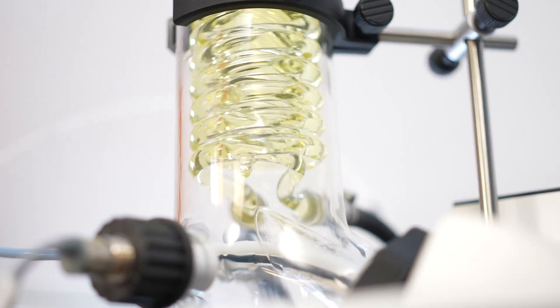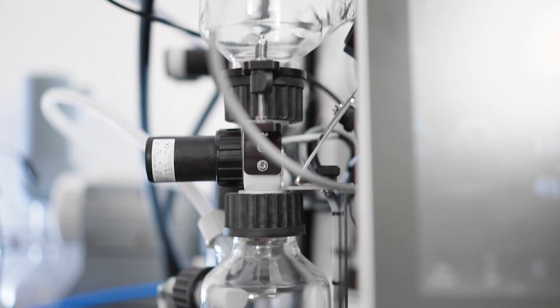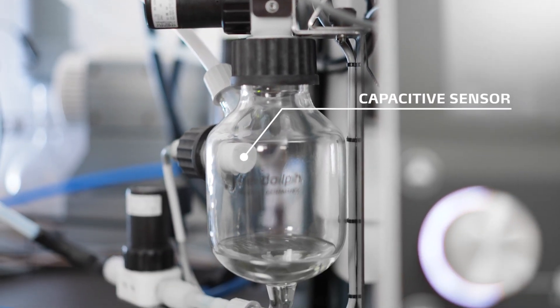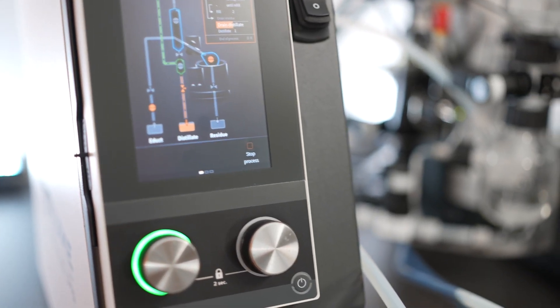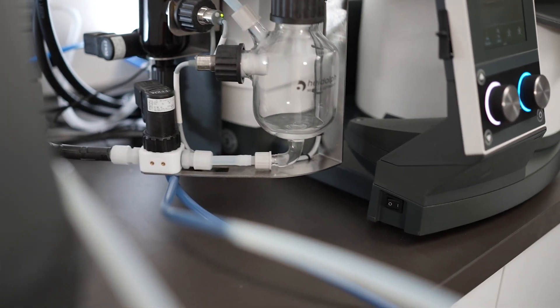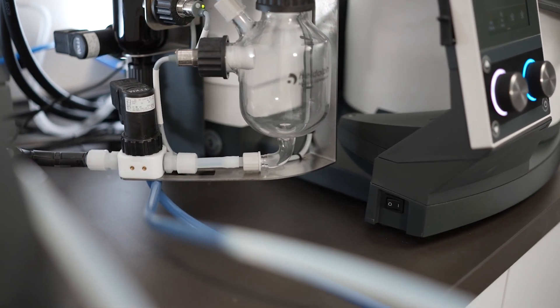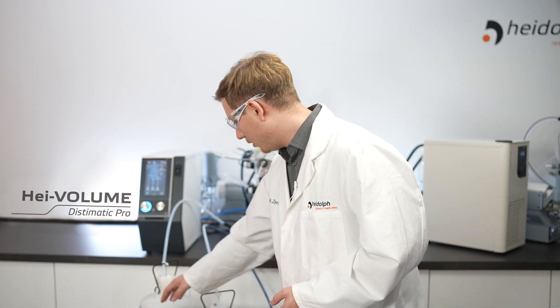This vessel is equipped with a capacitive sensor to detect the filling status. As soon as the vessel is completely filled, the Distimatic Pro separates the vessel from the rest of the system. The evaporation itself is not interrupted, but the system aerates the vessel and afterwards increases the pressure inside only this component to push the collected solvent out into a collection vessel or can.